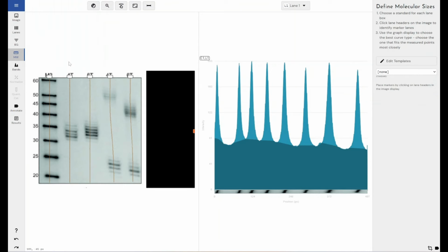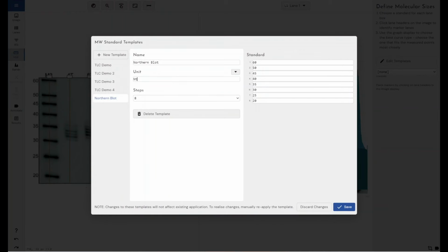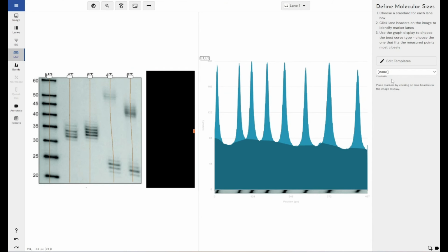So next I'll come down to assigning my molecular weight ladder. Now, because I've got these values here for my molecular weight ladder, this is nice and easy for me. So these are nucleotides. This is a nucleotide ladder. So what I'm going to do is edit templates, come down to a northern blot template that I created. My units are nucleotides. I have 8 steps. There are 8 bands, 8 kind of measurements within this molecular weight ladder, and I've already added these steps in manually to match the steps that are on my image. So if I click save, I select my northern blot standard and I left click on the top of my lane here. You can see that I start to get my molecular weight ladder here, and that means I get my measurements when I move through to the band stage.